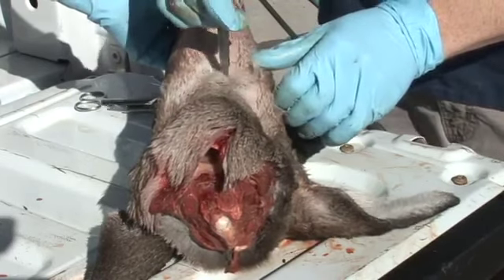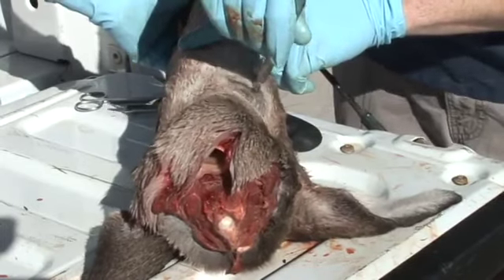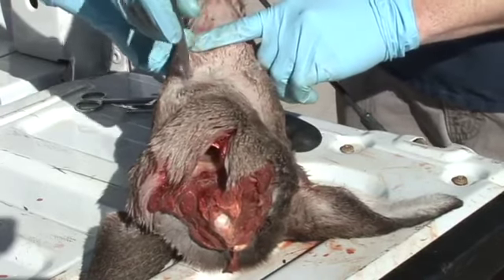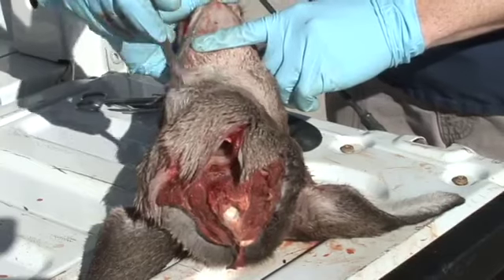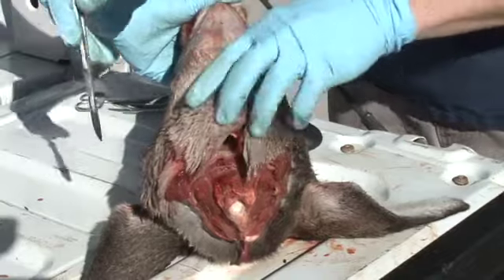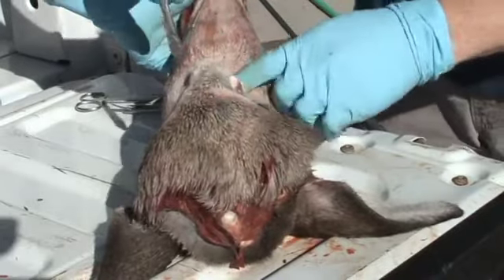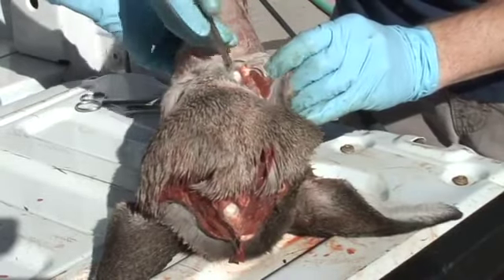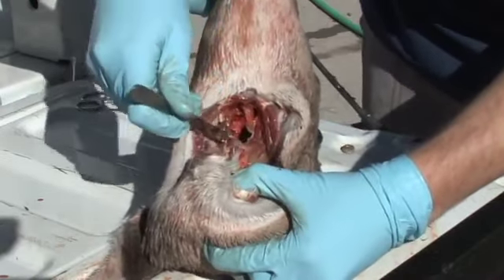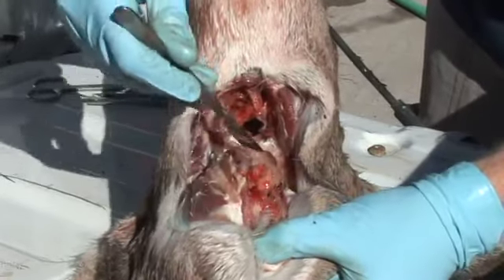From this point, cut laterally through the hide to both sides, and then downward towards the back of the ears. Next, widen this incision and cut deep through all the soft tissues of the throat. Cut at the larynx — this is necessary to retract away the larynx to give you better visualization of the sample area.